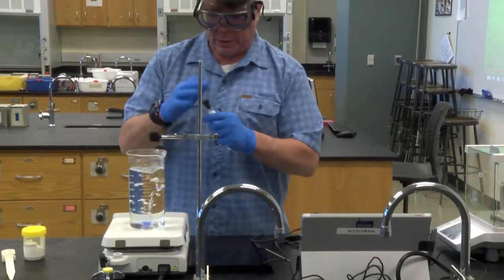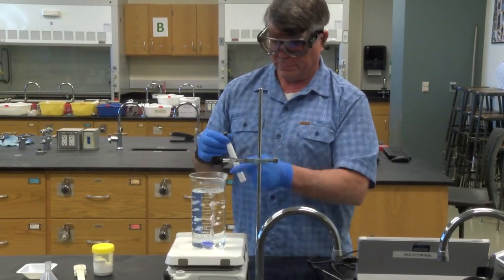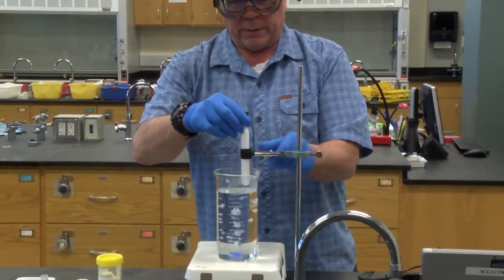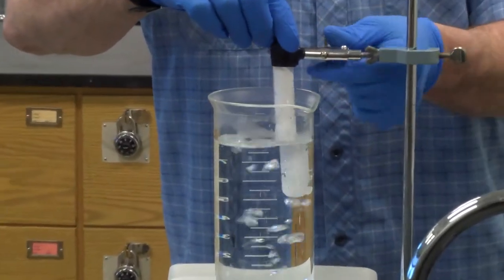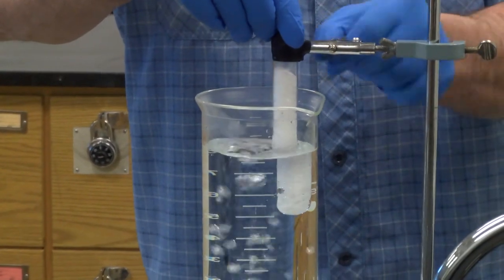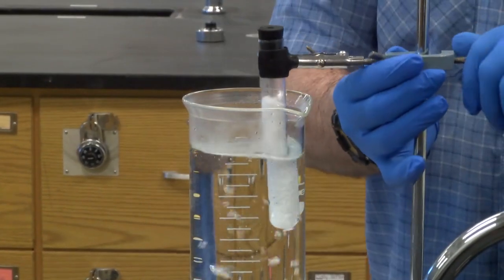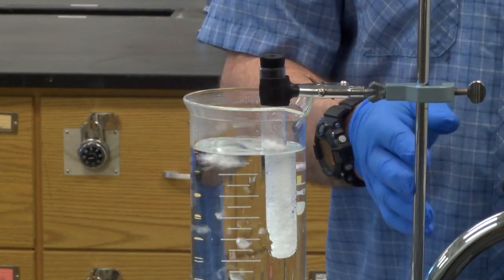So now we're going to melt the solid organic solvent, pure solvent. This is a ring stand clamp. So I'm going to clamp this down. And now we want to get that down as far as we can. So I'm going to clamp it right about there. Once that's on tight, I'm going to lower this as much as I can. And then we're going to wait for it to melt.